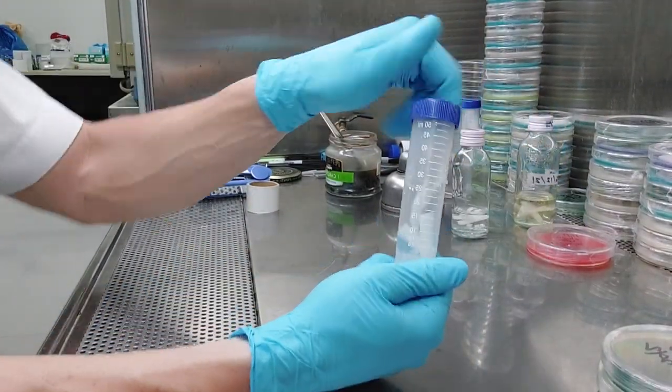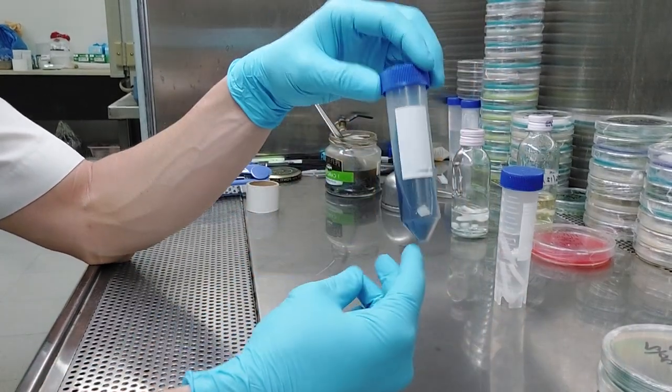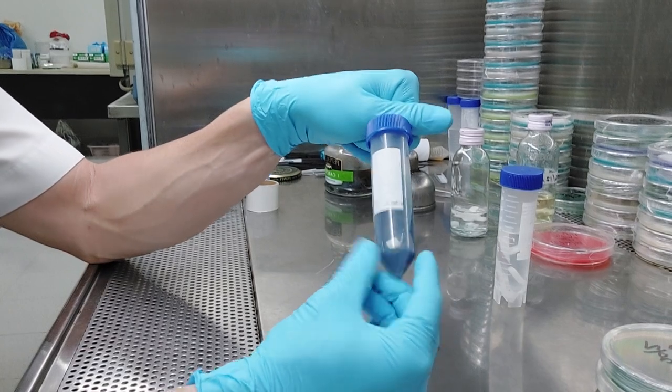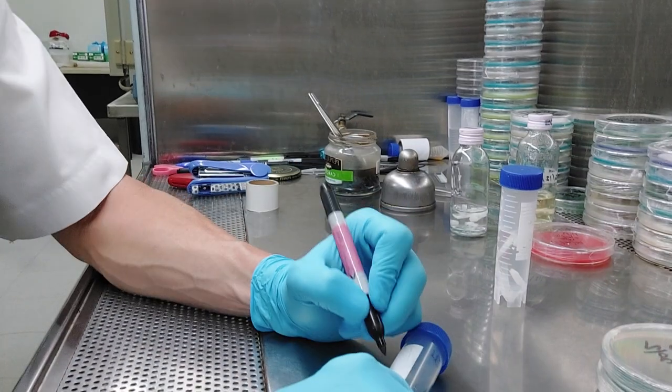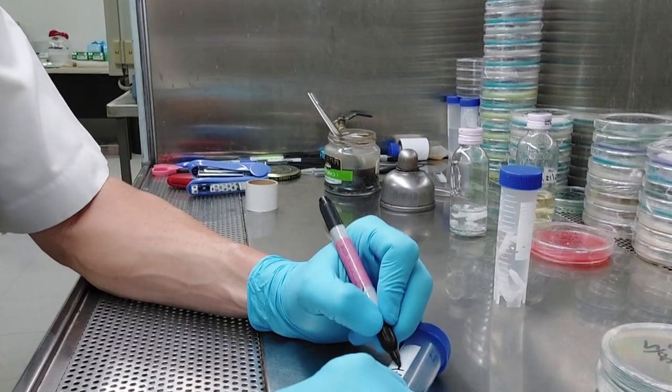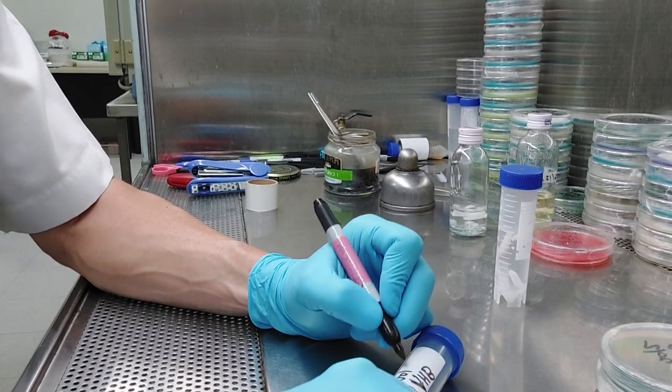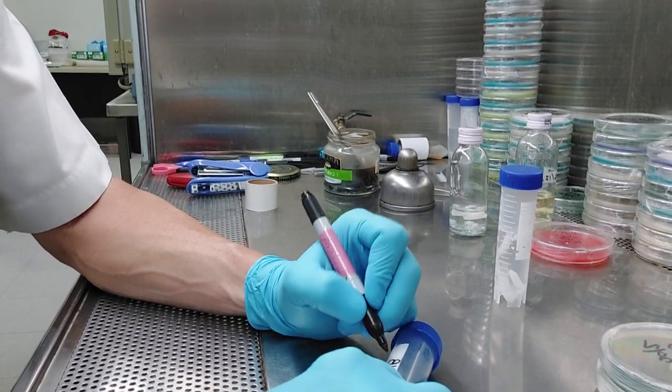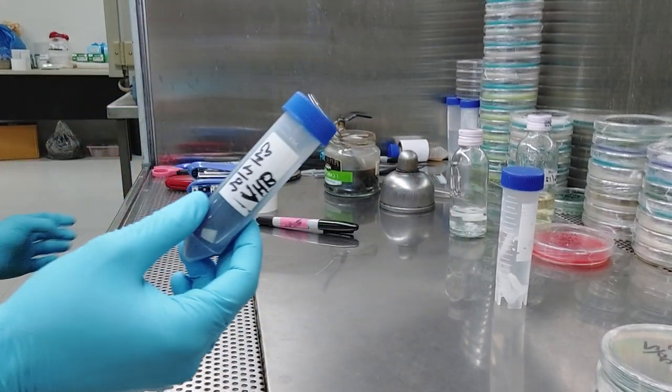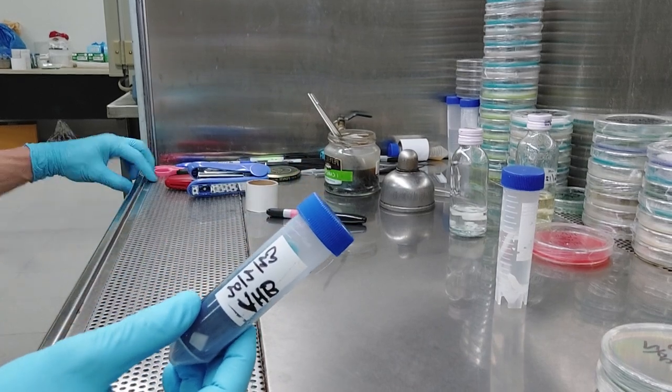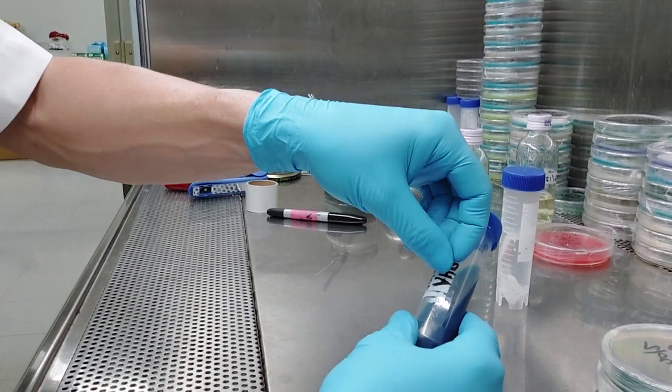And so, and then I have my PP5, polypropylene 5. That's the recycling code. I'm going to label this in a second. I have my kind of older conical style here, centrifuge tubes. Remember, I'm going to label that in a second. Oh, I wanted to notice, I wanted to say one more thing, guys. You put your label on here. Okay. And your date. I do the date like the way we do it here in Asia. I do it day and month and year. So I'm going to write that on there. I do a couple of things, you guys. I already ripped off a piece of tape, which is stuck to the hood now. Make sure you cover up these letters.